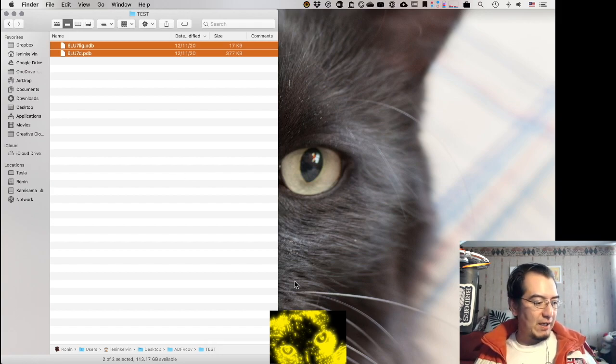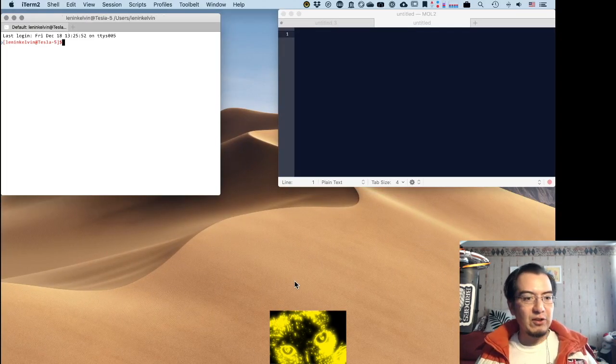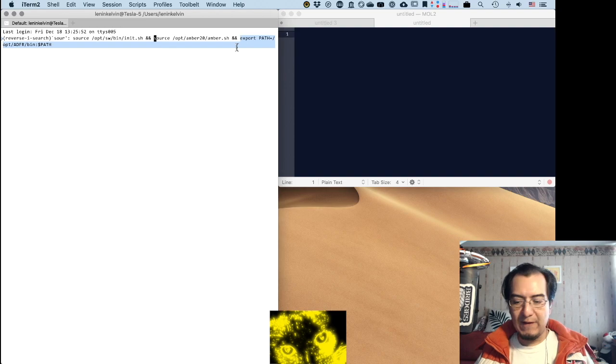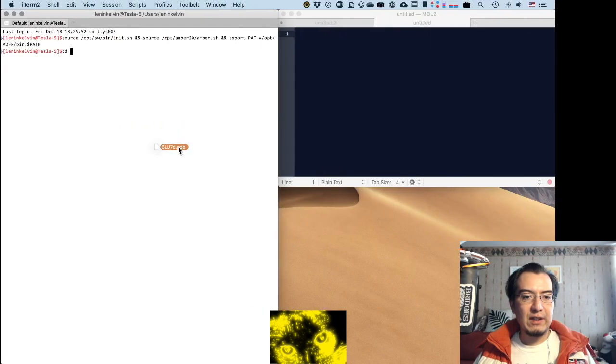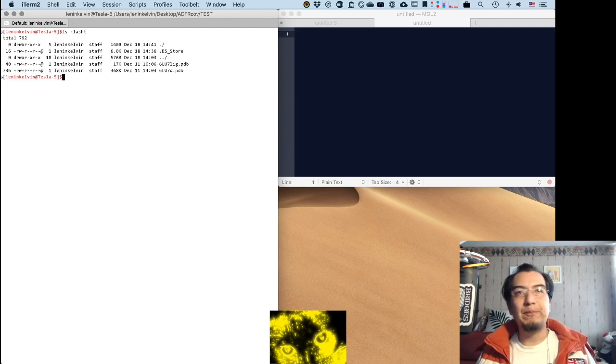So we need a terminal. In my case, I use iTerm, and I'm going to load the path that belongs specifically to ADFR. There we go, and move myself to that folder. These steps, of course, are totally different for different architectures and different setups. Now, let me pause for a second.